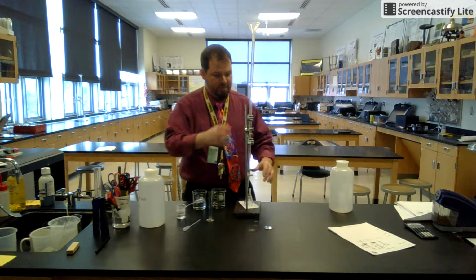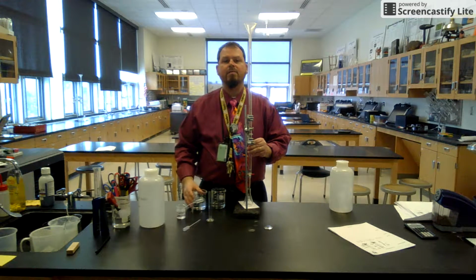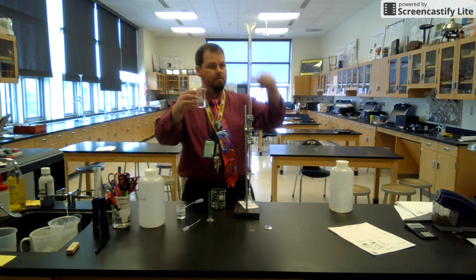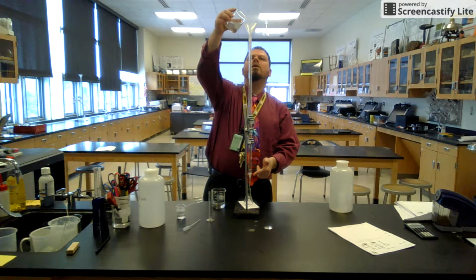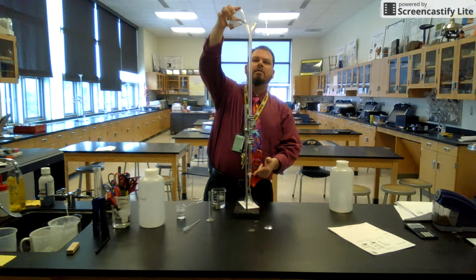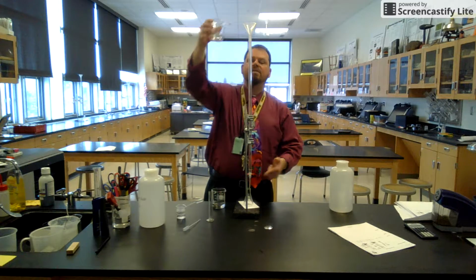So next things last. Base goes in the burette. Ready? Say that with me now. Base goes in the burette. BB. So I got a funnel. I'm good. It's closed. I'm going to fill up the burette with base. If we all stick to that, I don't need this emptied every time. So if you come up to the burette, you should have base in there.